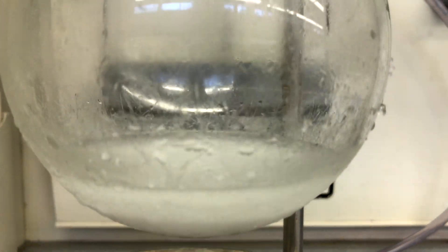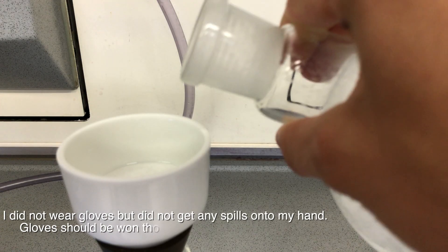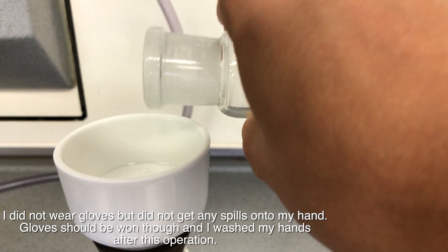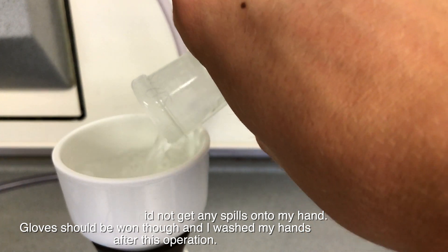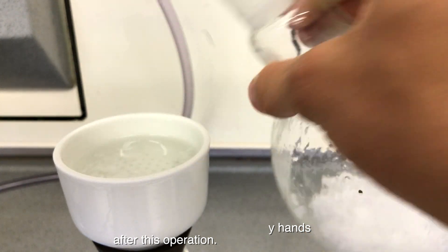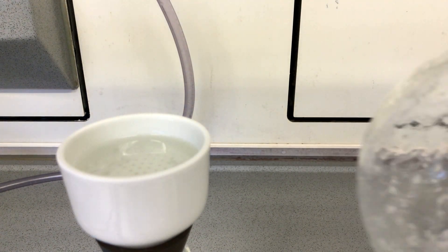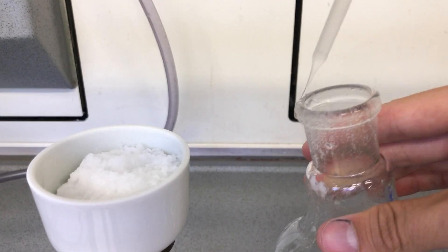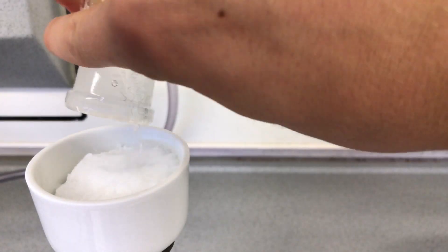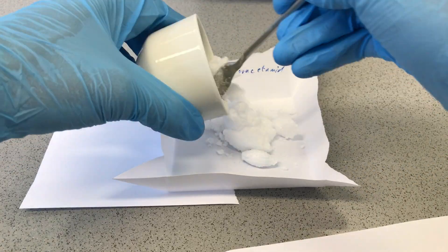At the end of the reaction, everything was allowed to sit in the ice bath for 15 more minutes before performing a vacuum filtration. Chloroacetamide is poorly soluble in cold water and therefore it crashed out as a white powder. Everything was vacuum filtered and afterwards I washed it several times using distilled water. And there you have its beautiful crystals of chloroacetamide.